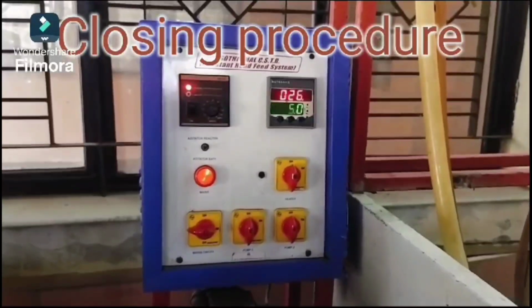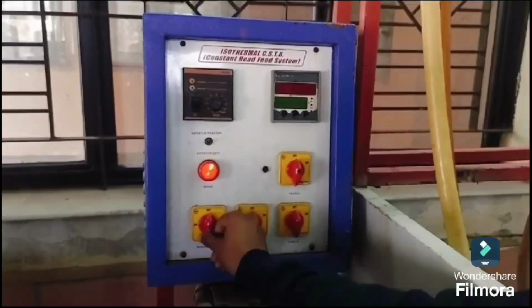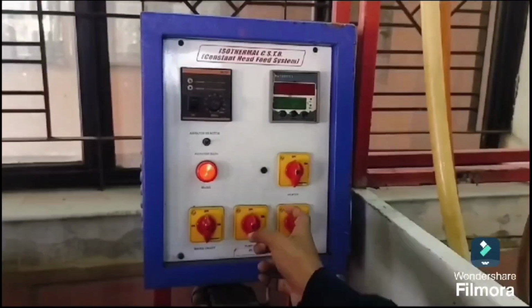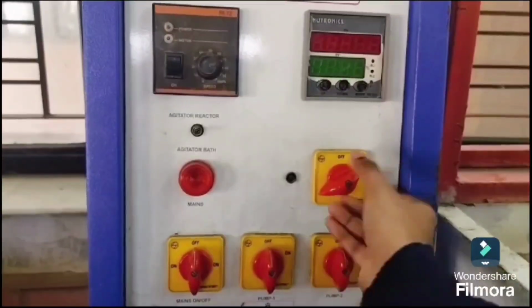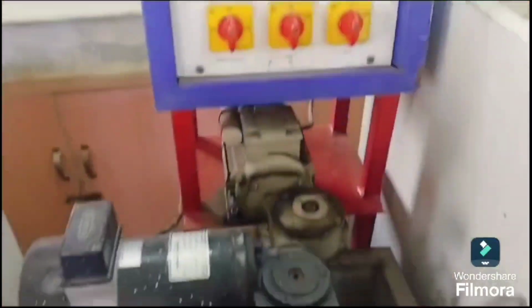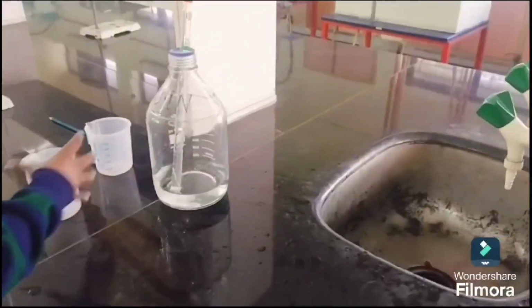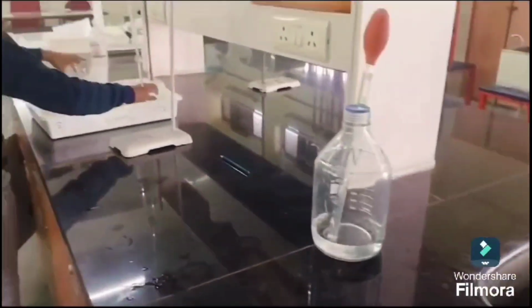Closing procedure. We have to switch off all the mains of the apparatus after the completion of the experiment, where we are switching off pump 1 and pump 2 to stop the flow of the chemicals. We have to switch off the heater. So when we switch off the pump, the flow of chemicals into the CSTR will be stopped. And wash all the glassware items after finishing the experiment.